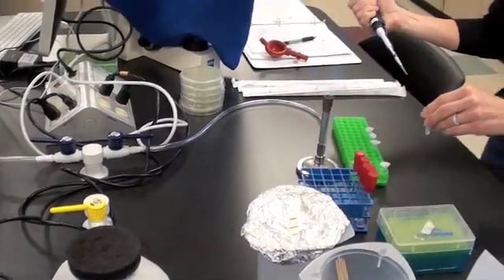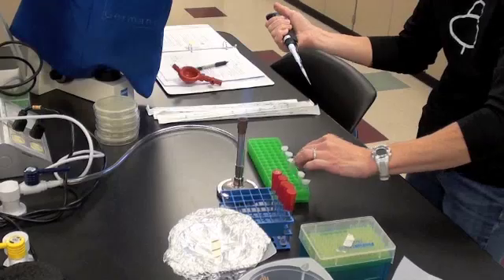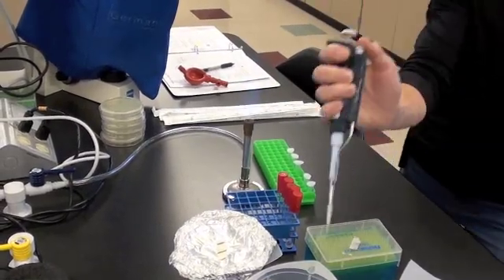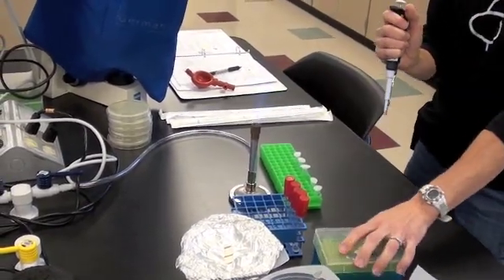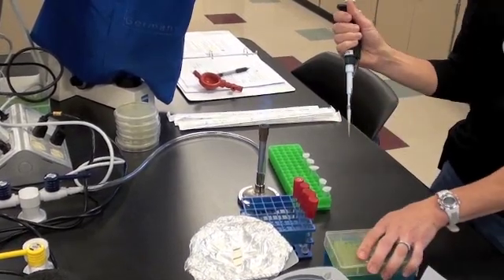She mixes it well, places it to the left in her rack. She's going to discard that tip that she just used and pick a fresh one. Now she'll make the next dilution.